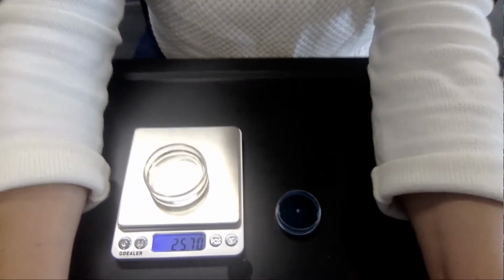For today's lab, we are going to be burning ethanol. So I have a bunch of things set out here and we're going to get started. The first thing that I'm going to need to do is find the mass of my ethanol. So I'm going to start with my balance. I'm going to turn it on. And then I have a container of ethanol here. And once my balance reads 0, I'm going to place the ethanol on the balance.